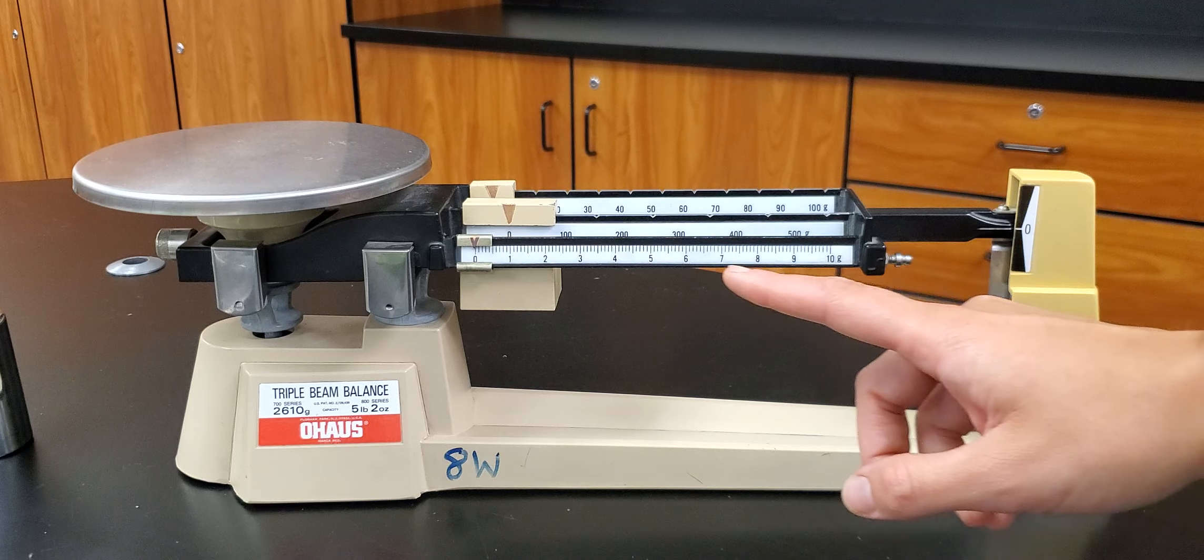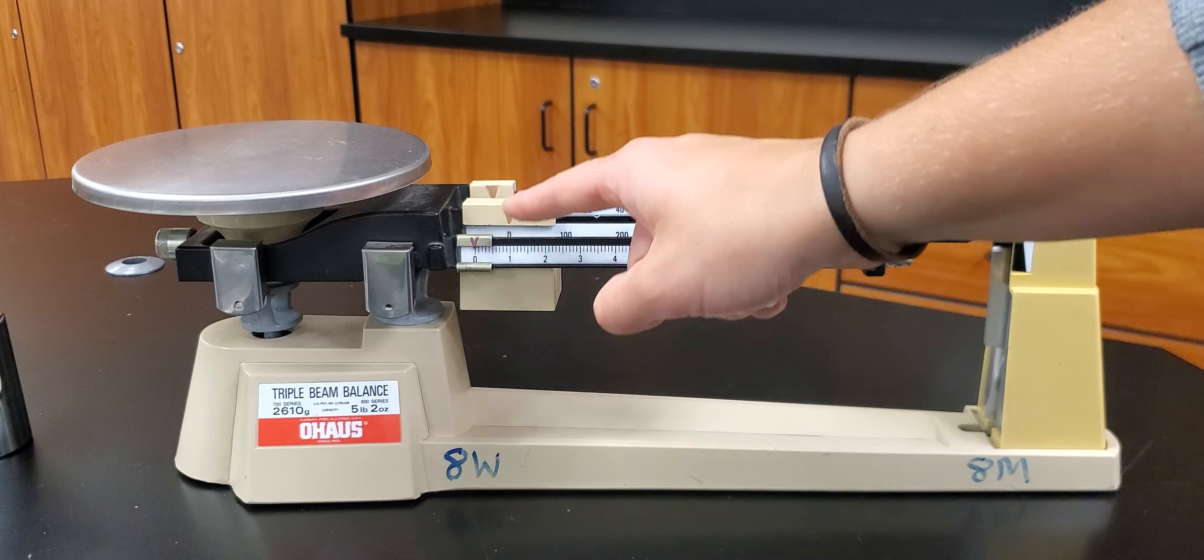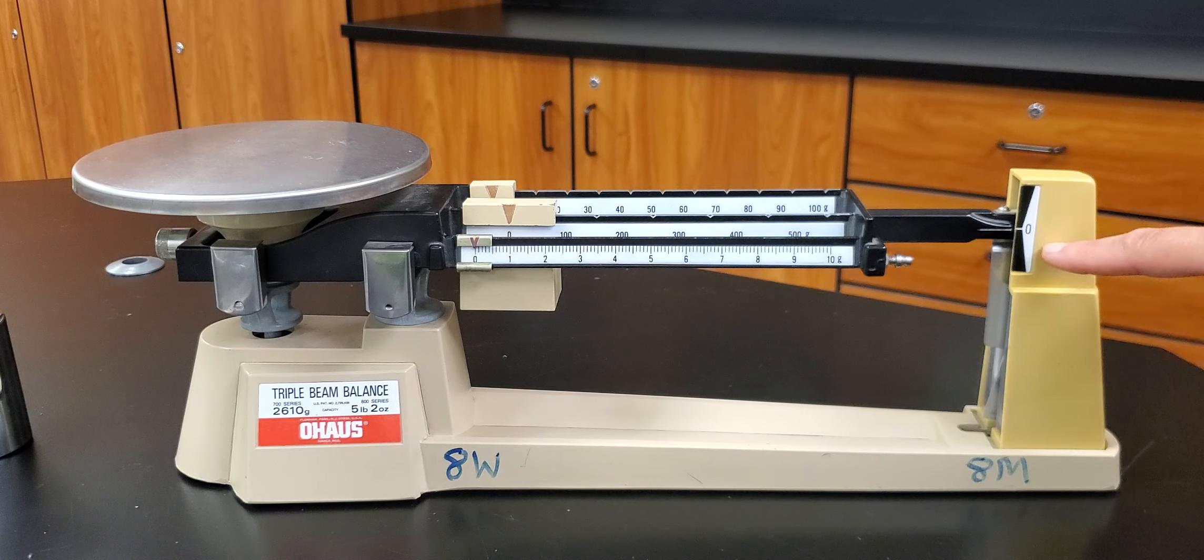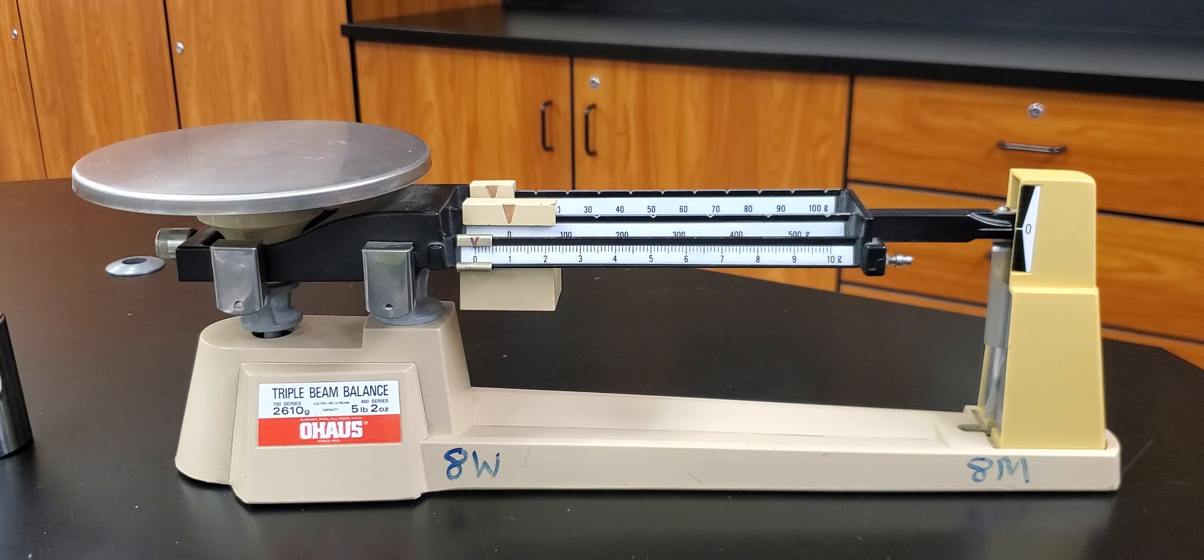One really important thing to do before you start measuring anything is to make sure it's working properly. So if all of these weights are reading zero, then this arm over here should also be reading zero. If that's not the case, call me over, I'm gonna fix it for you.